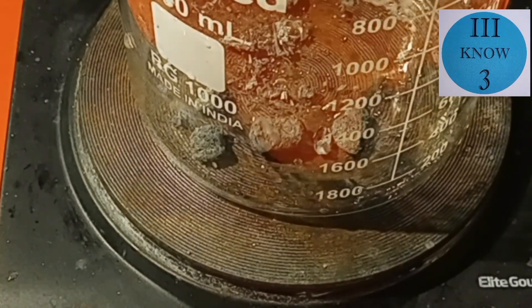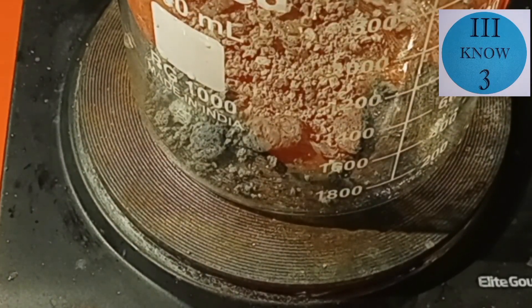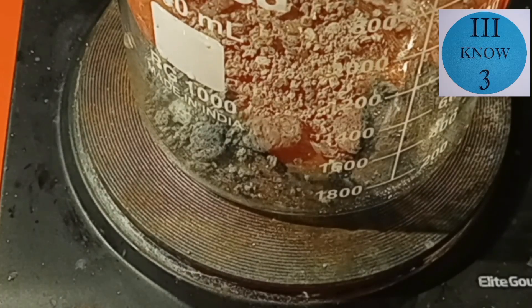So we're going to put it in the beaker on the super scientific hotplate and we're going to start the next step of our refining process.